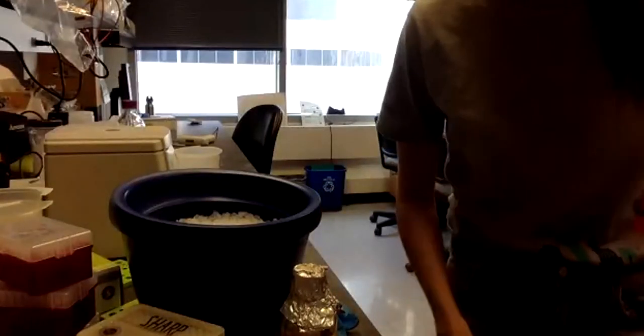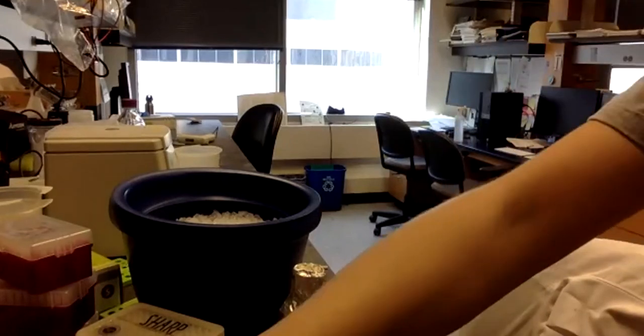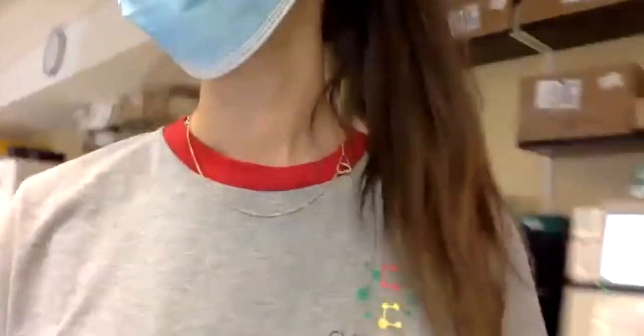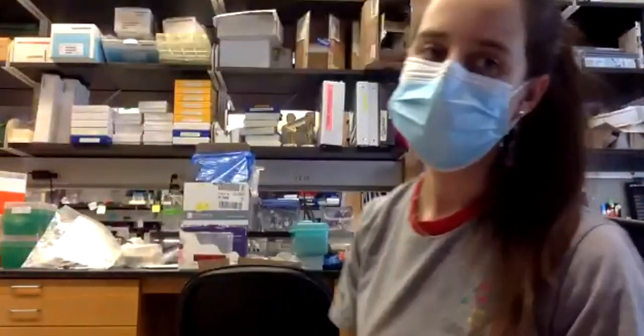But when you put them in ice or in colder places, the bacteria won't grow that fast. It can grow, but not very fast. So we will leave it so that it can recover and divide a little bit, and then we will put the bacteria in the plate.